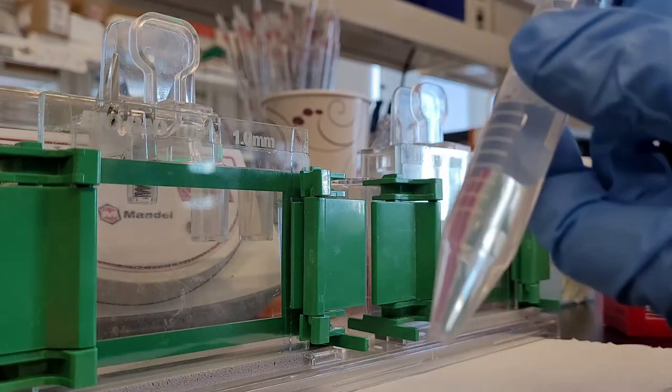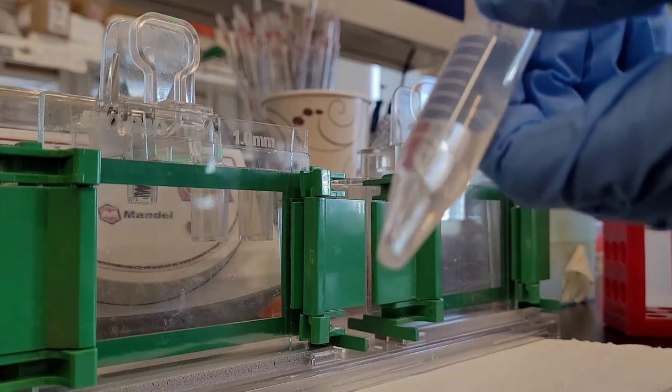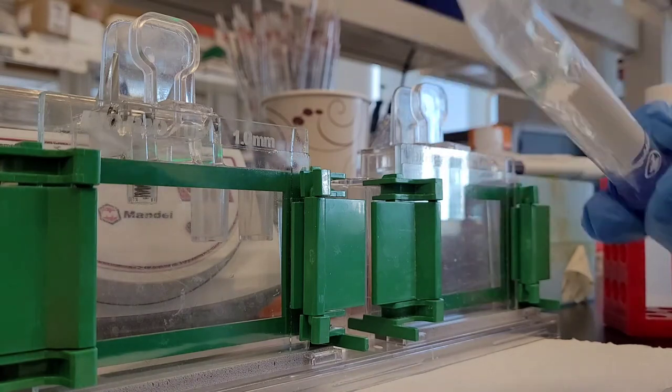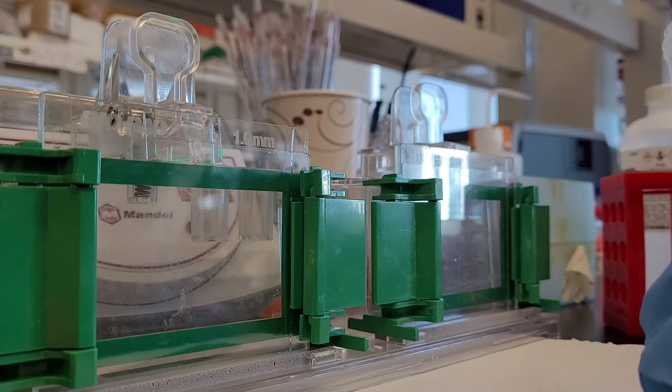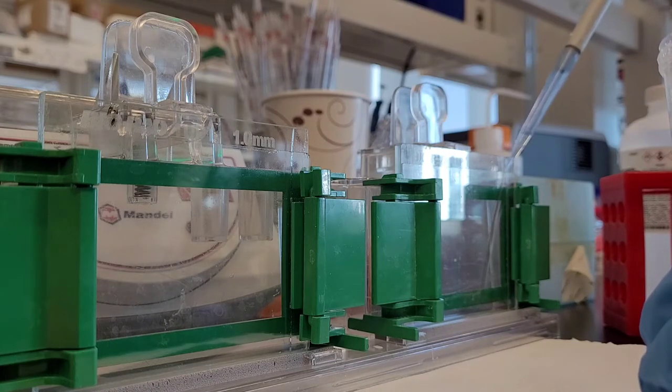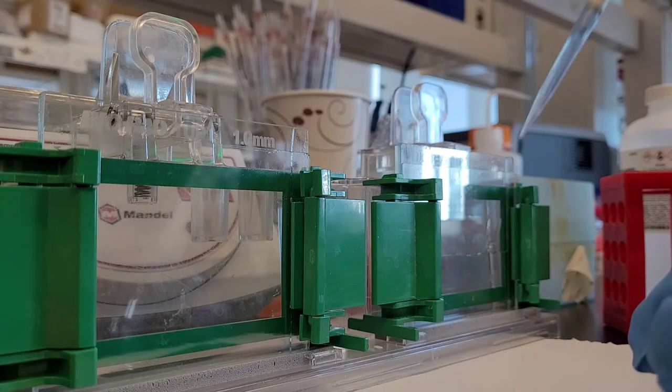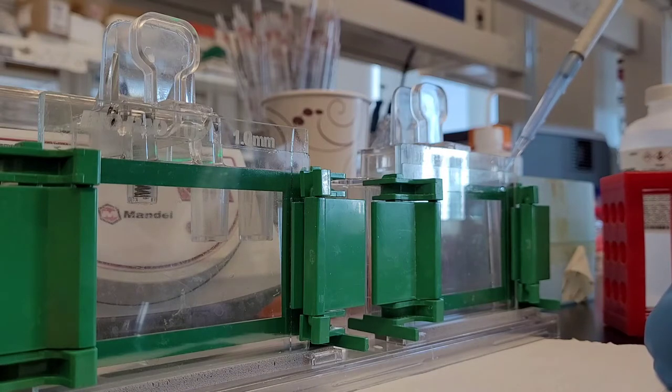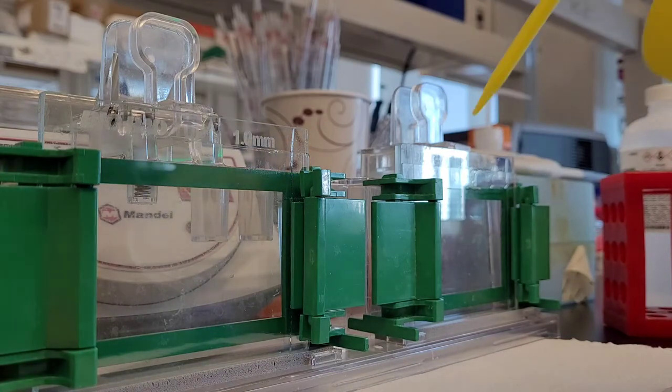I add about 2 microliters just because I have enough time today to wait, but if you really want to speed up the polymerization you can add maybe 5 microliters. The amount of TEMED and APS is not written on rock. You can change it up a little bit. If you want to speed up the polymerization, I suggest adding more APS and TEMED. If you notice that it will polymerize as you're pouring it, which has happened to me before, you want to decrease your TEMED solution and APS.